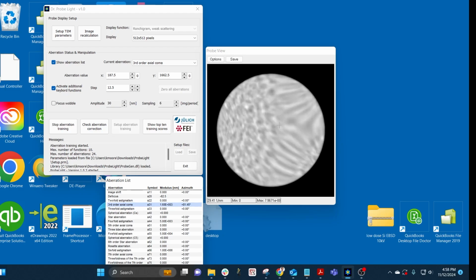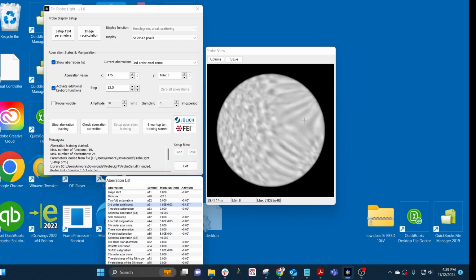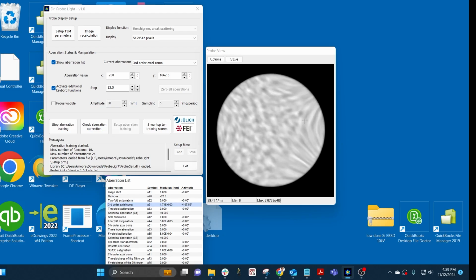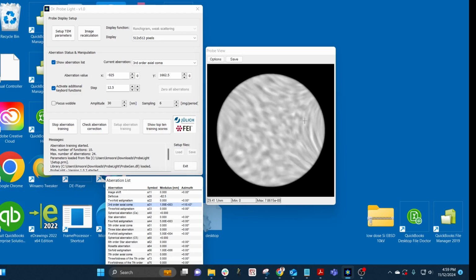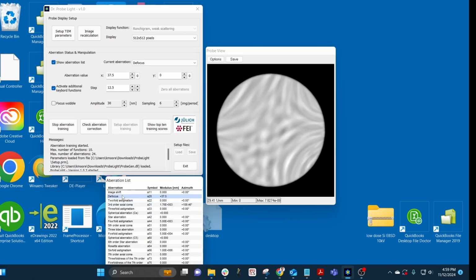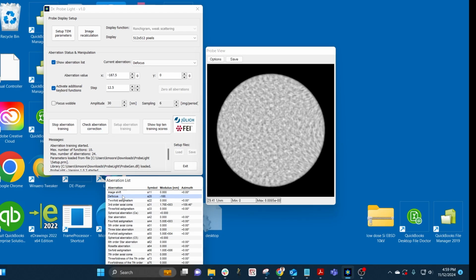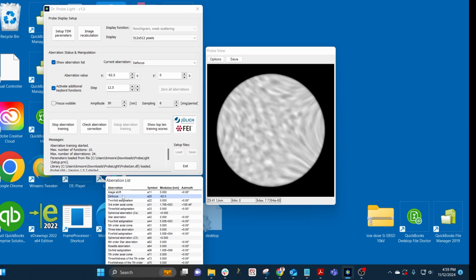So we'll try adjusting it. That's clearly worse. I've gone back to making that diamond shape over here. I'm going to go the opposite way. We're zooming in. And now you can see that's actually too far the other way. So I'll go somewhere in the middle. Something like this. So I'll try to go closer to focus to check. Yeah, so now I can see I'm zooming straight in and out of the center. I don't see so much of a flashing across the screen.